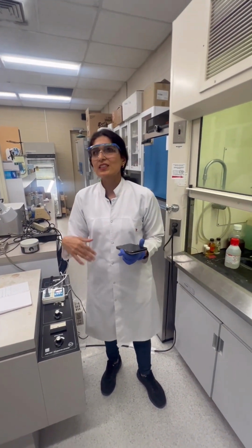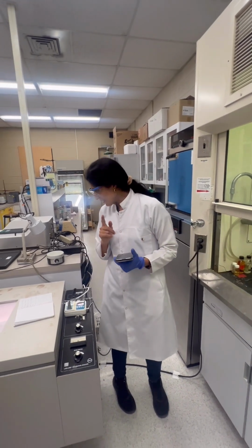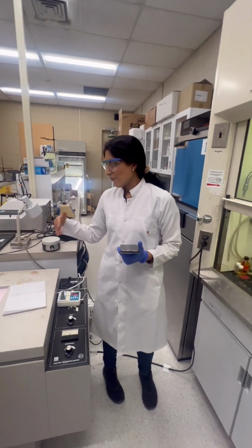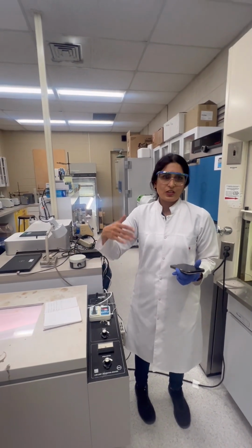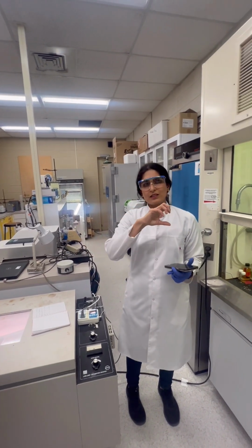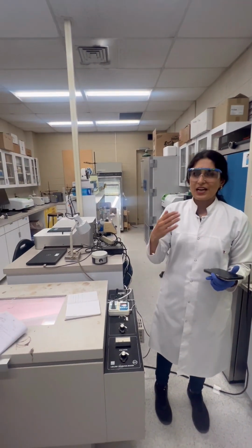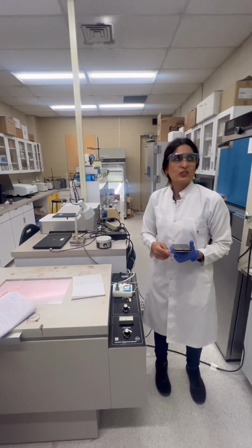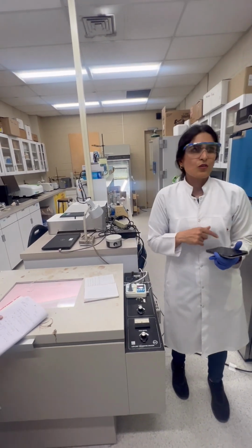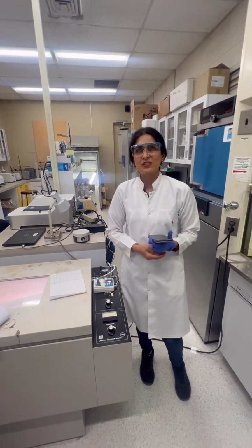And we repeat 3 more times. For each step of washing, we should use a centrifuge to decant the solution from the graphene. After repeating 4 times, we can put it in the oven at 90 degrees for around 24 hours.